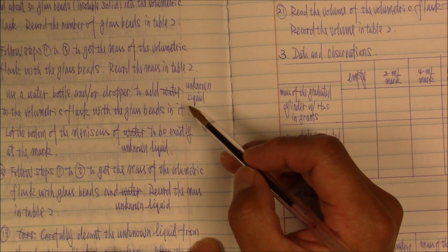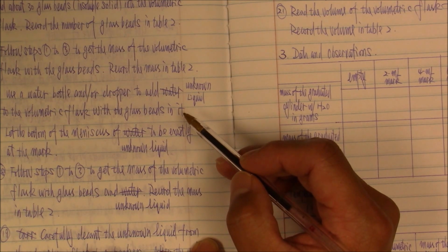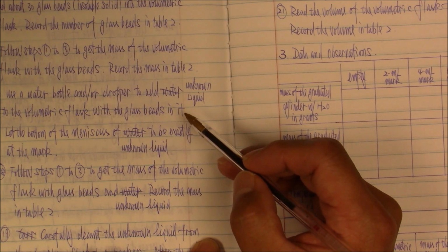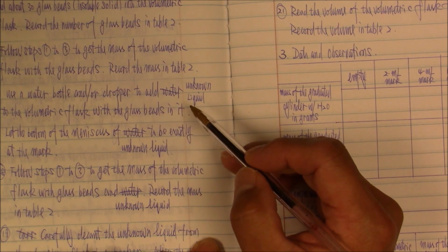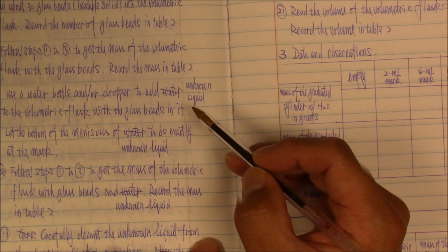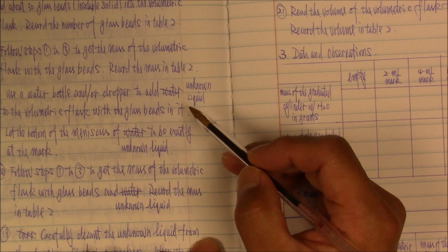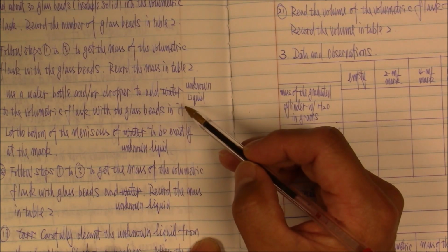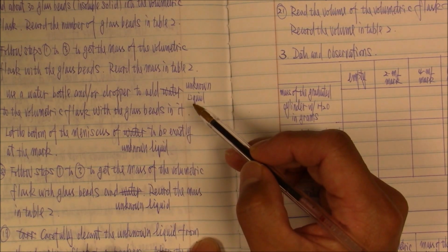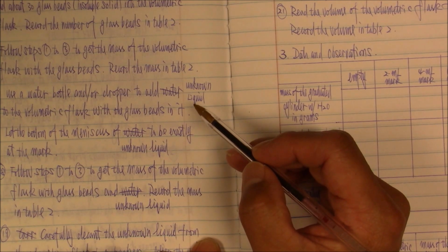Another reason to put a line on top of the number or the word is sometimes when you analyze your results, you may realize that, oh, the original number was correct. Then you still have the numbers. And also, do not scramble the words or the numbers. Make sure you put a line across. Make the word still readable.